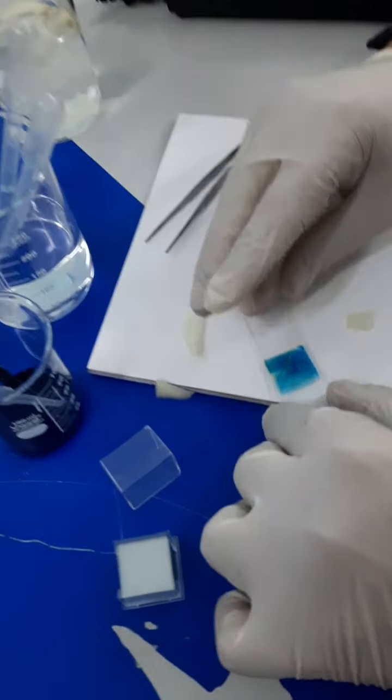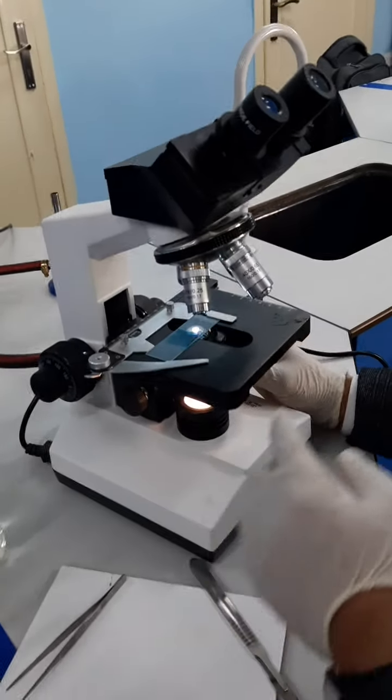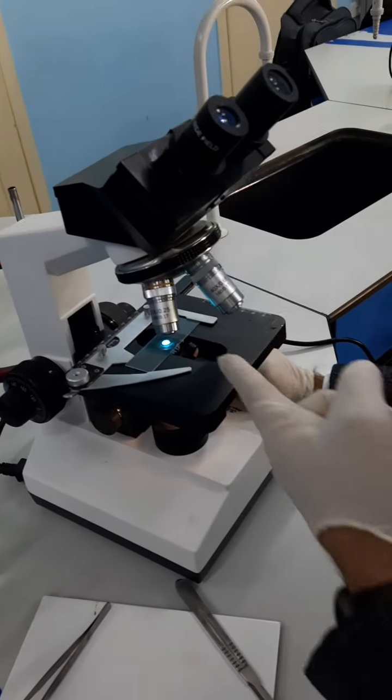After you do so, you need to use the microscope. Step number 1, turn on your microscope. Step number 2, lower the stage to the bottom. Do not ever forget that. And then place your specimen at the top of the source of light. So for example, some students go like this. Now the light is going through the glass, so you see nothing basically. Make sure that the light goes through the specimen.